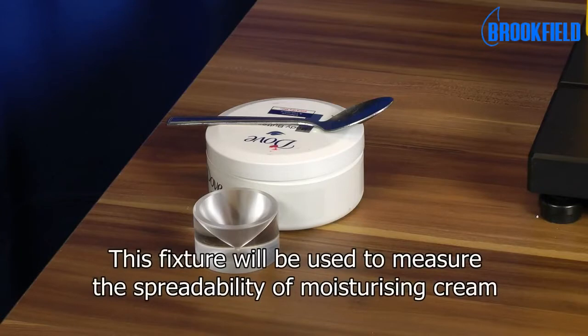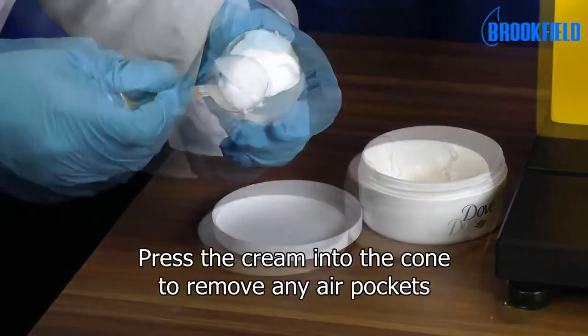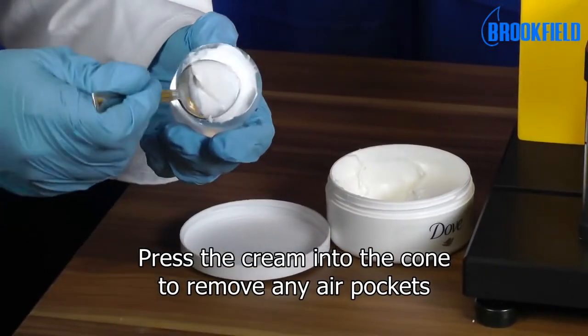The fixture will be used to measure the spreadability of moisturizing cream. Fill the female cone with the moisturizing cream and press the cream into the cone to remove any air pockets.